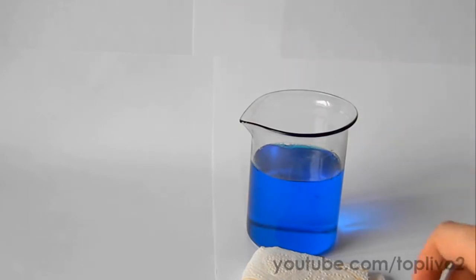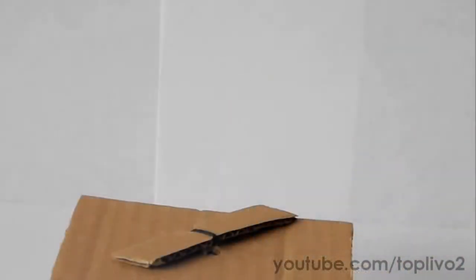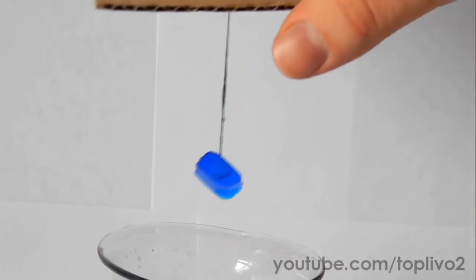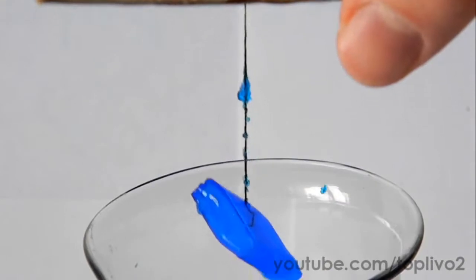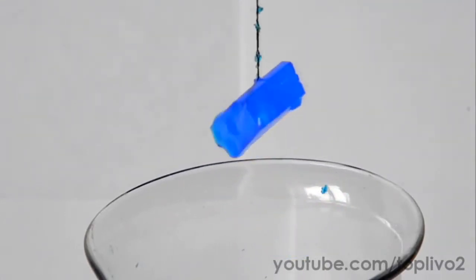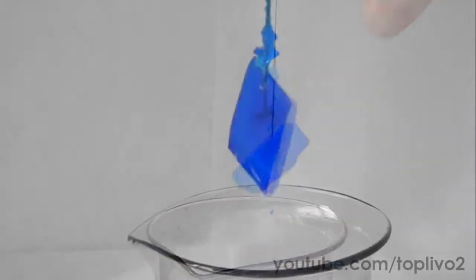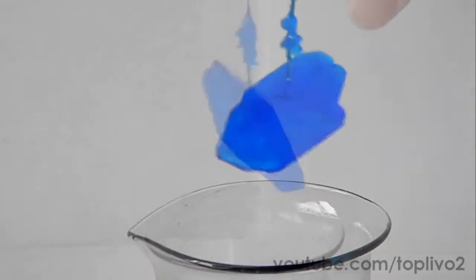A polycrystal is when a lot of crystals fuse together. Now I'm going to show my crystal growth stages. I haven't filmed all the stages, but anyway — the first week, second week, third week, fourth week, and so on.